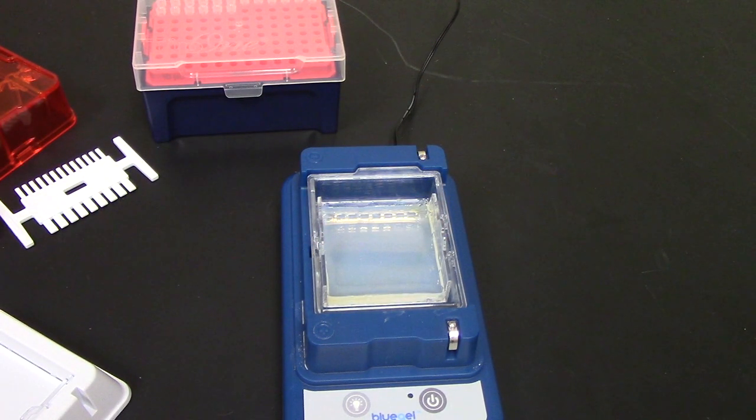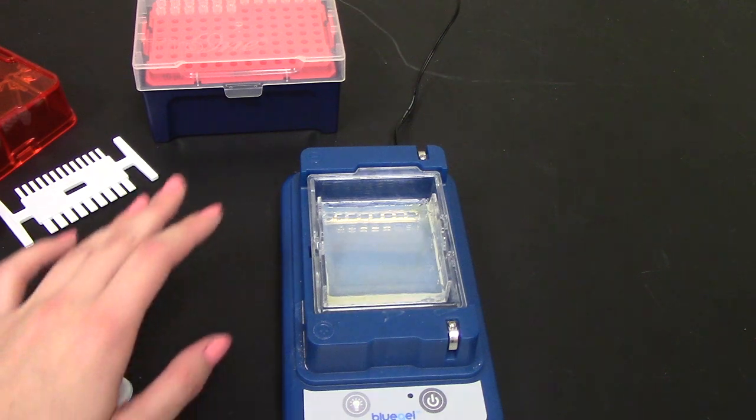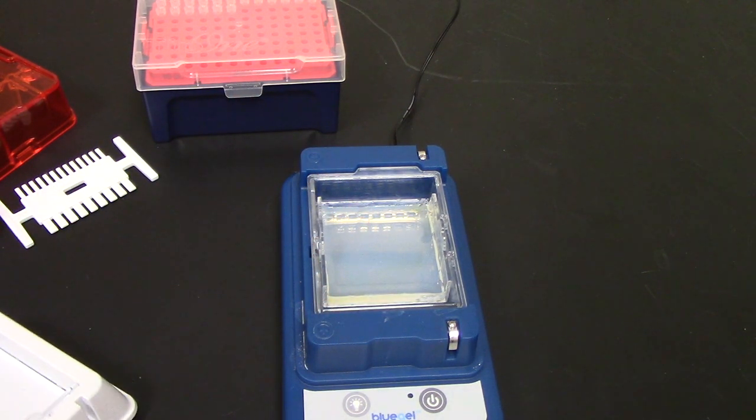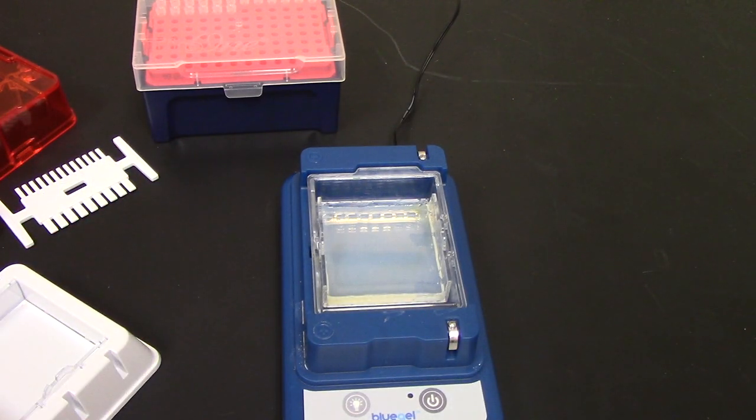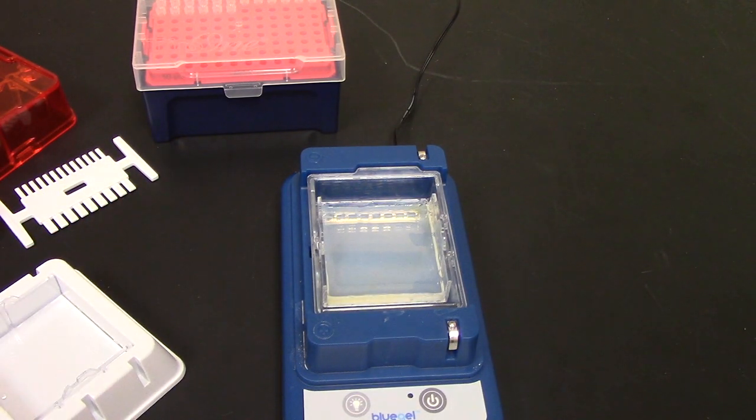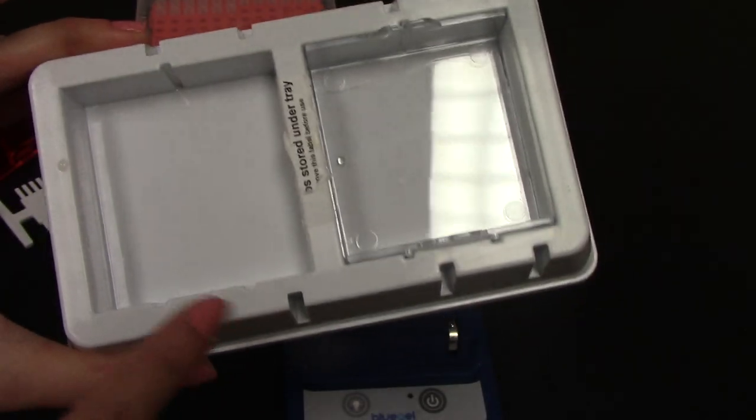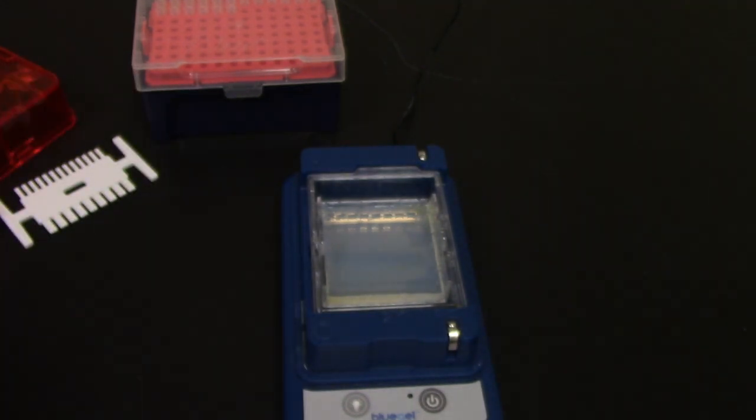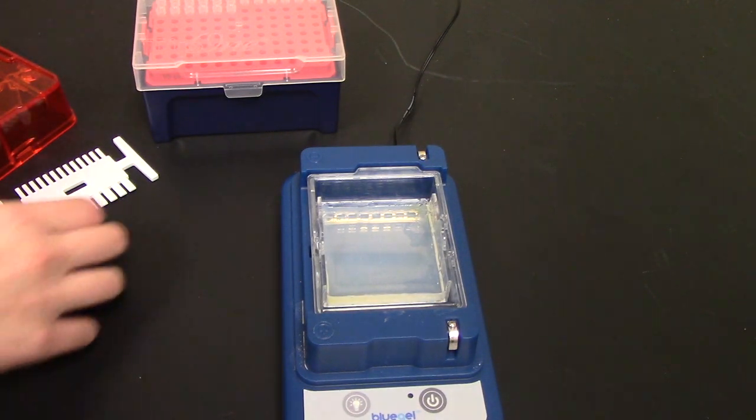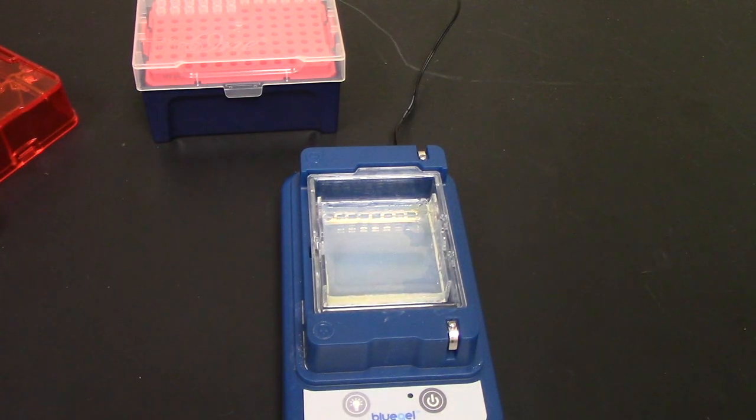But do be cautious that if you try to put the gel in the wrong way you can get it stuck, especially in these slots. This is really nice for preventing you from running it the wrong way, but I have gotten the tray stuck in the tray holder the wrong way.